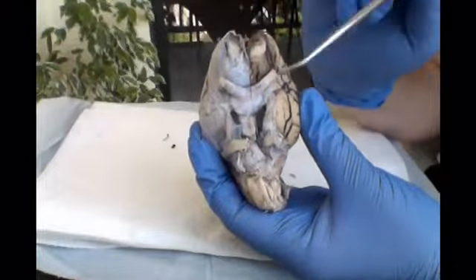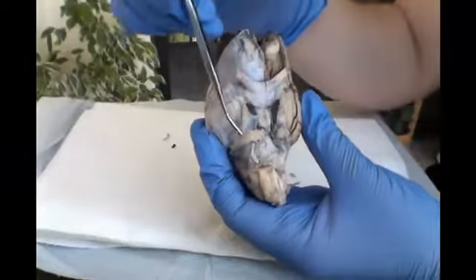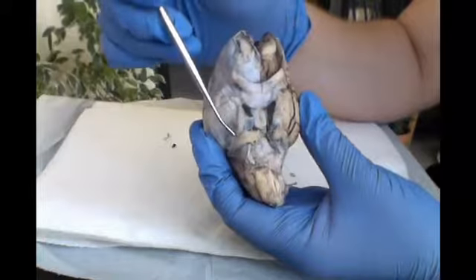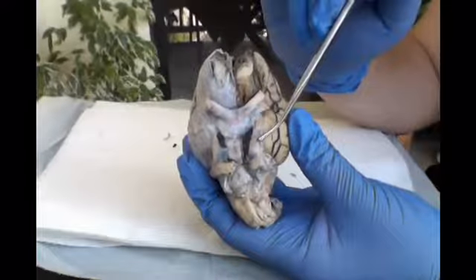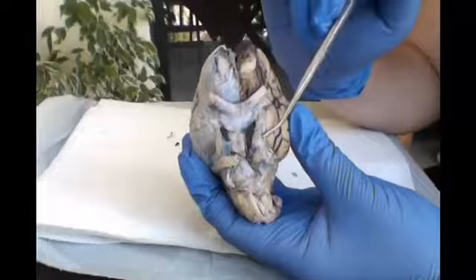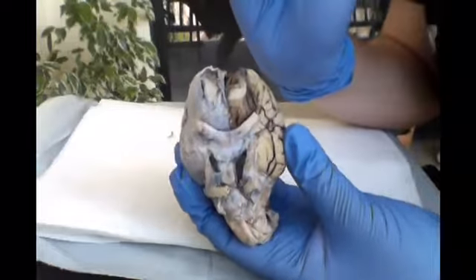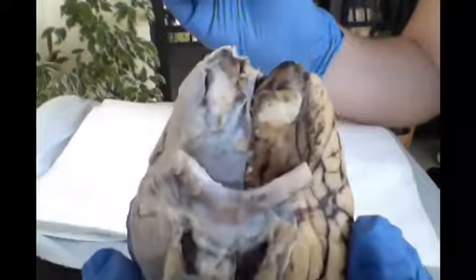And the first is going to be the oculomotor nerve here, number 3. Down to the left is the trochlear, number 4 here. Then looking to here, we have the abducens, which is number 6. And then just behind that is going to be your 5th cranial nerve, which is the trigeminal. And those are your nerves of the brain.